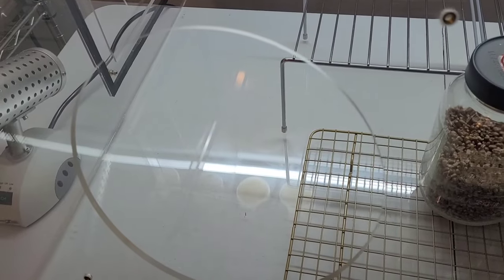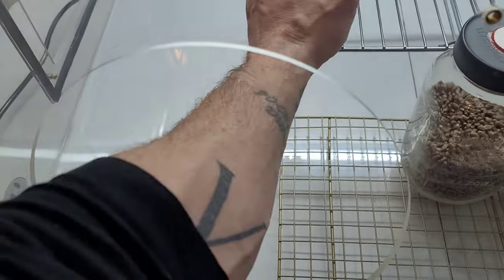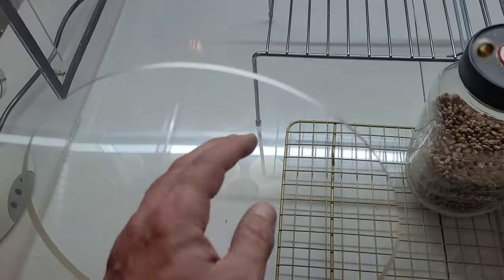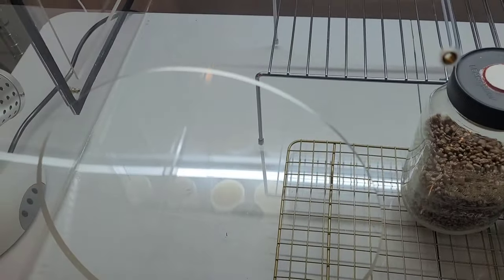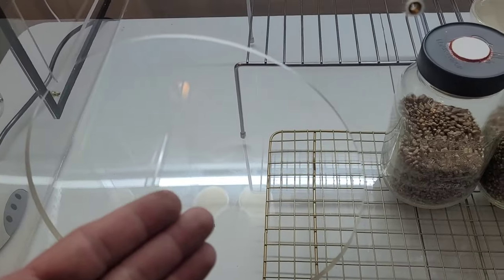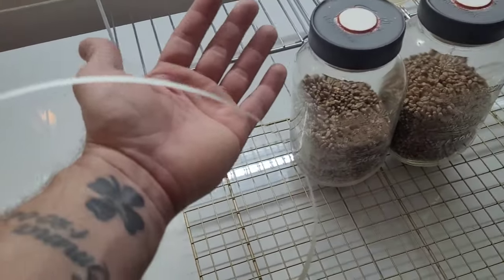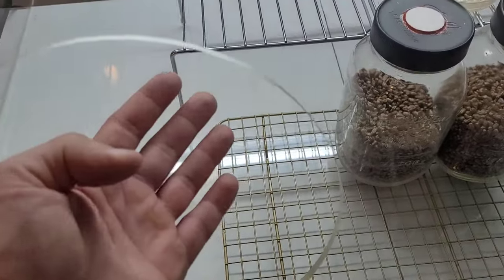Now the armholes need to be much larger than your arm. As you can see, there's free movement in and out. By having a larger opening, you're allowing for less turbulence to take place as your hand moves in and out of here.